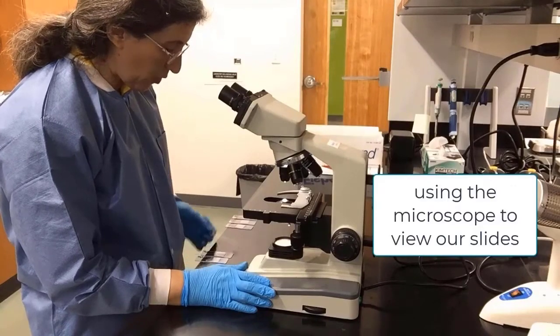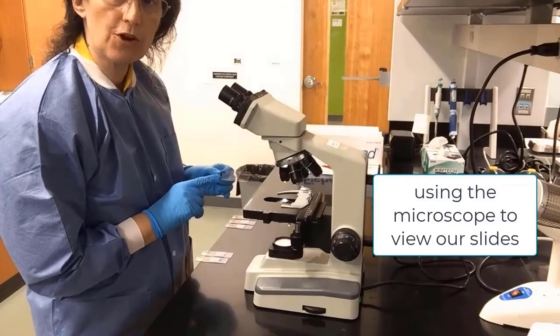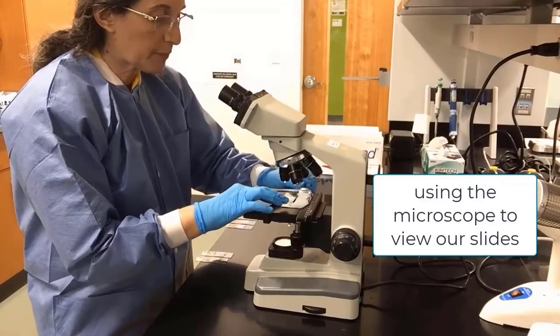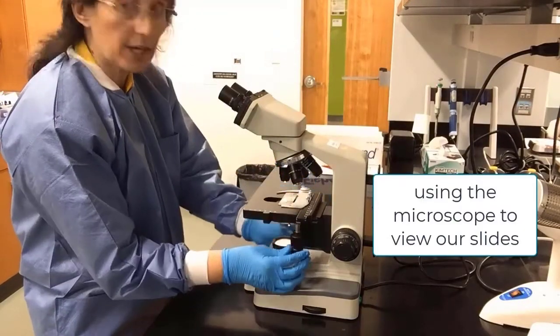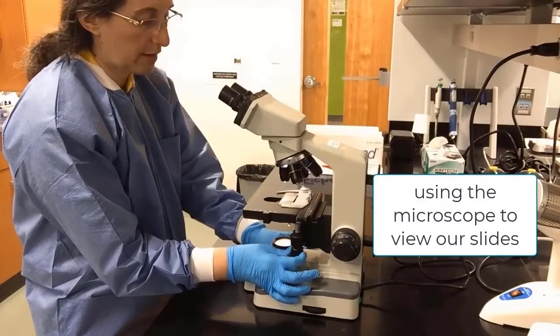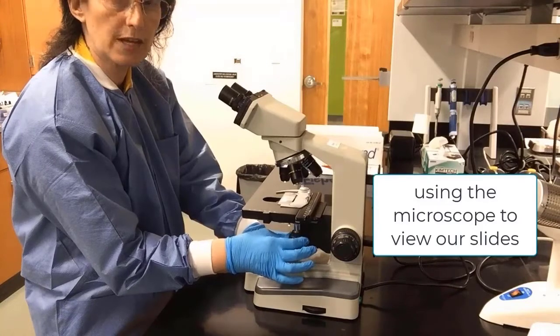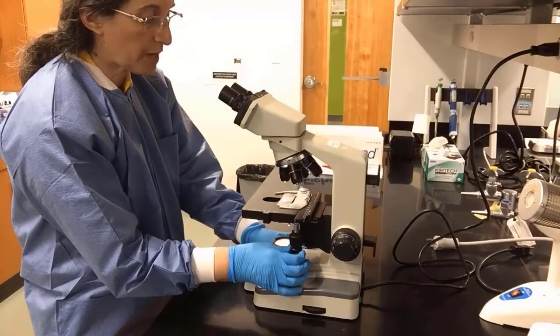Using the microscope to view our cell slides, we will pick up the E. coli slide first. Make sure we clip it. We can move it with the mechanical controls, north, south, east, west. We can use those to move the mechanical stage.